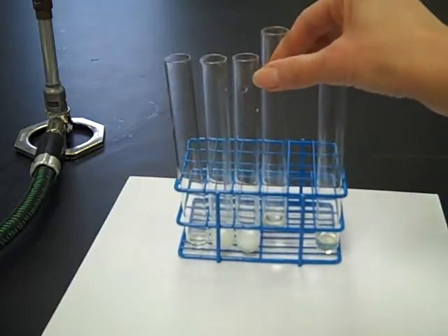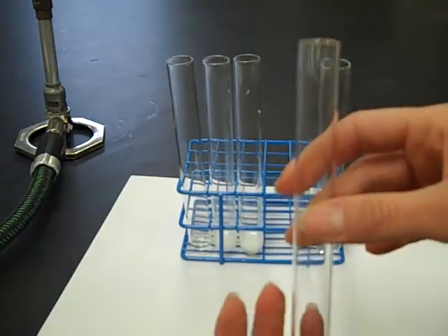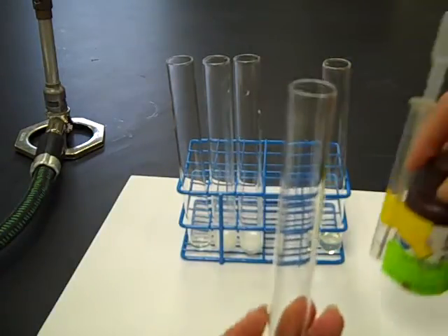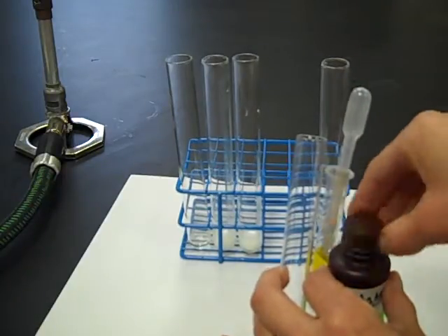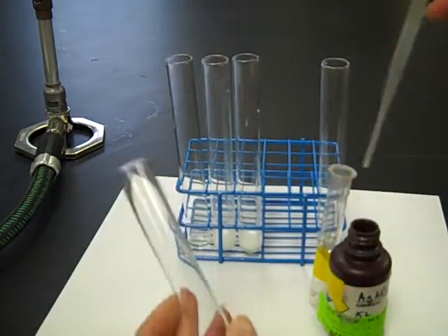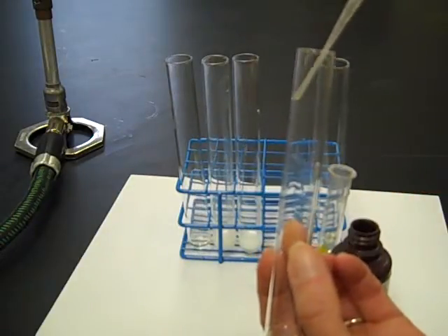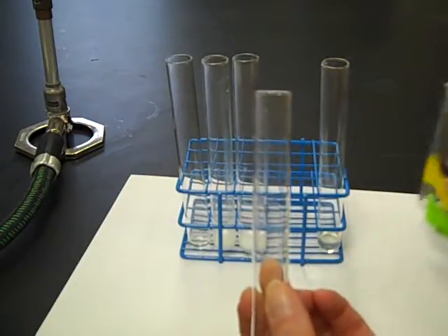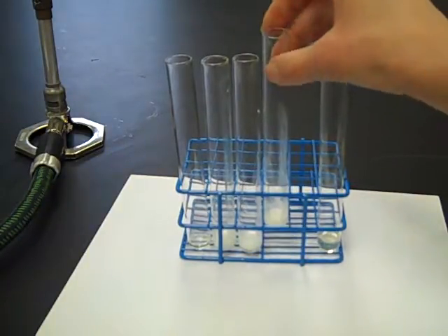To the third test tube, we're going to add silver nitrate. Silver is a heavy metal. See, the same result, insoluble.